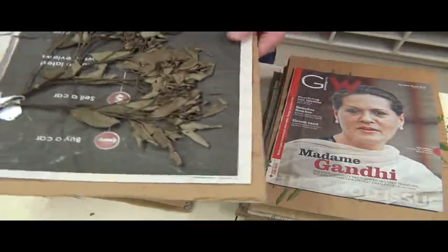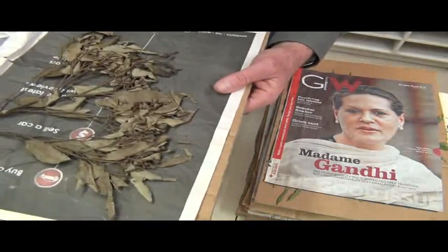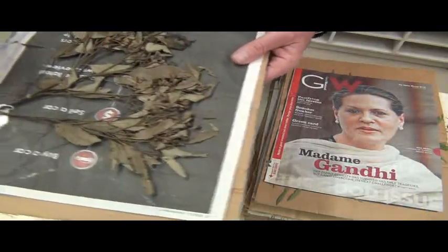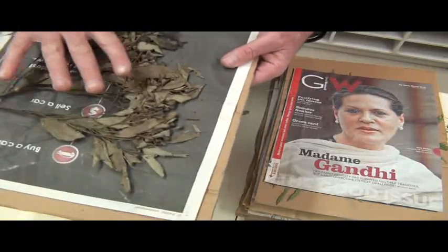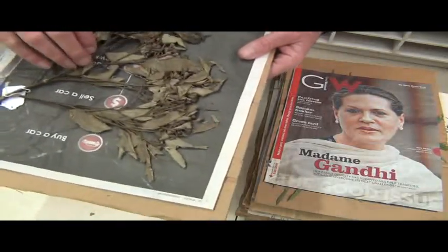I've been collecting since about 1974. If you had material off this plant, if this was one bit that had been collected to provide the fruits, then some small branches of this, for example, which I've just broken off — well, you won't want to present that, I'm telling you — but something like that could be part of a specimen that includes fresh material that's being pressed and dried.